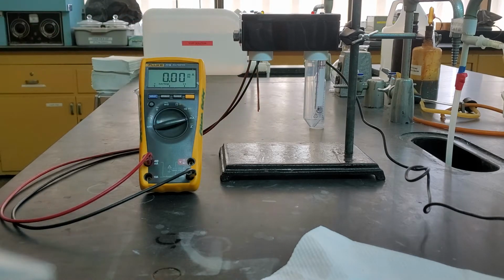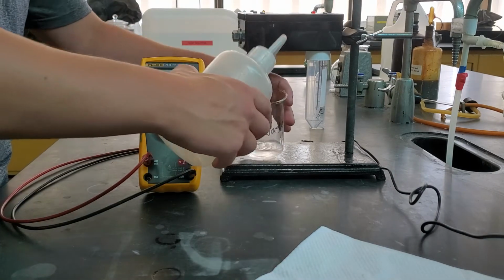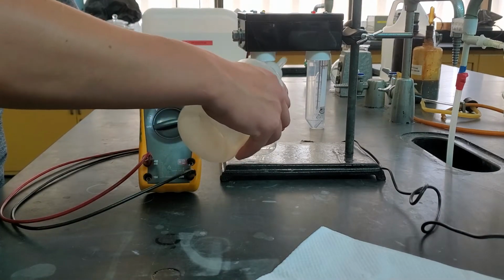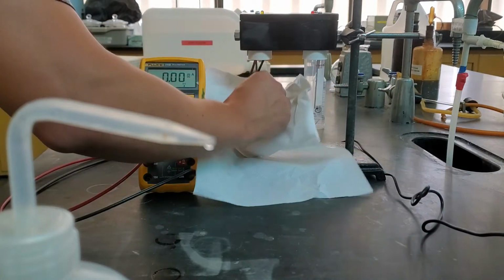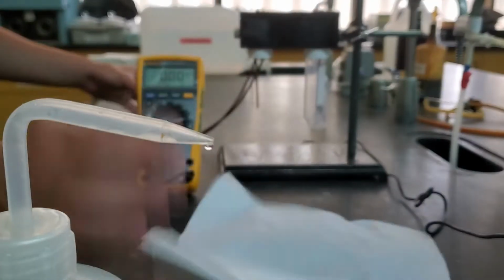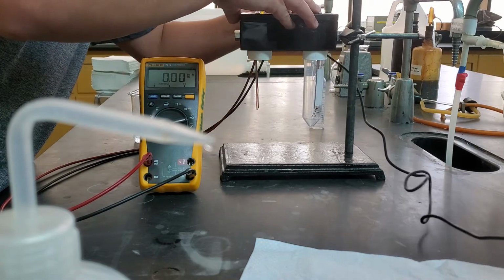And then I can go ahead and take that off, unpower, rinse. This time I definitely want to make sure I rinse off all of that tap water. And then we can move on to our next one. Gotta plug it back in, gotta give it power.